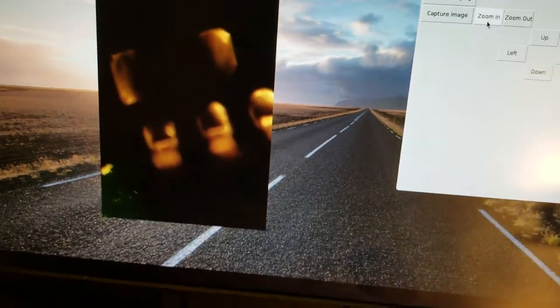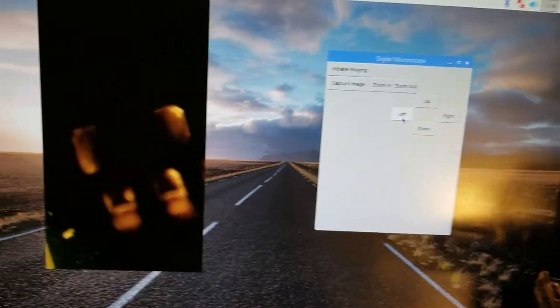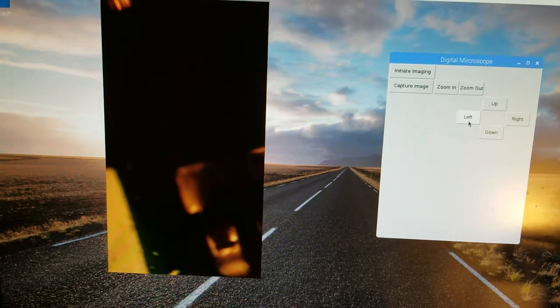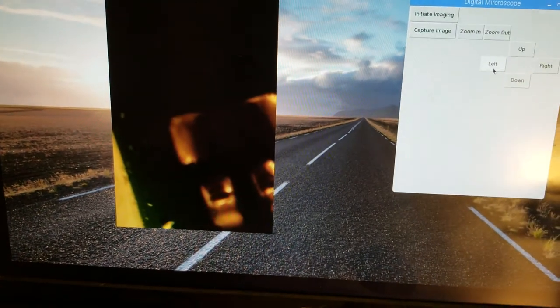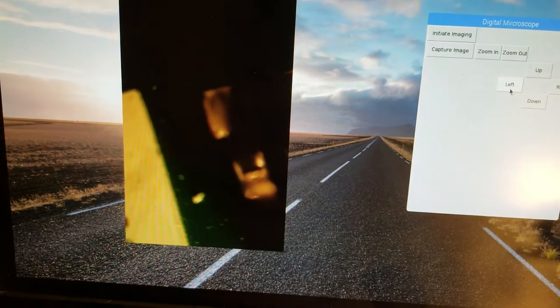We can adjust for any movement in that by moving to the left. And as you can see, we can move very slightly left every time we click. Again, the railing isn't perfect, so it's not going to move the same exact distance every time. But we are getting some results.